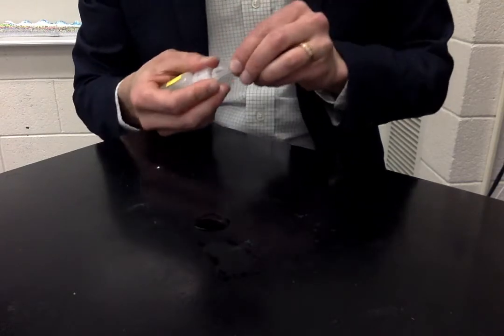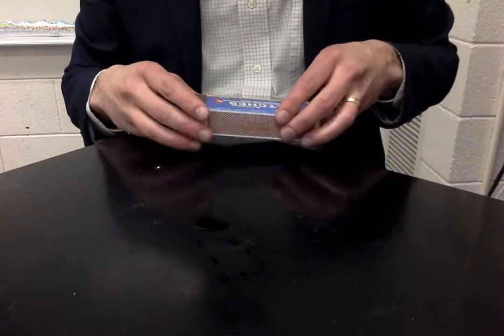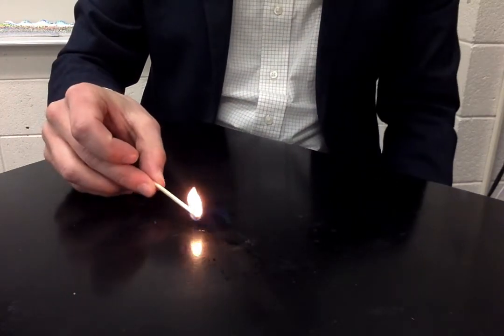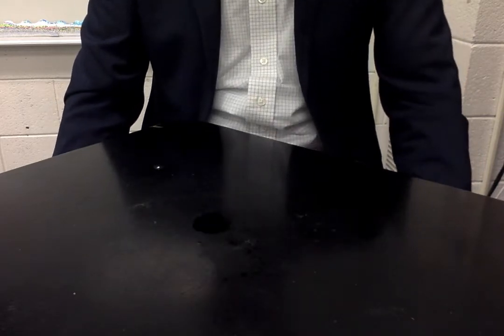This is one of the more dangerous ones. In Minnesota about 5 years ago, there was a bad accident that happened involving this chemical. In a small fire like this, it's no big deal. You can see it burns really clean though. There's no orange. Pure blue flame, and that one's done.